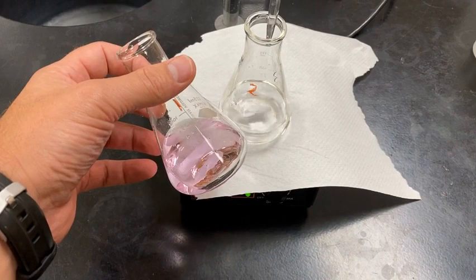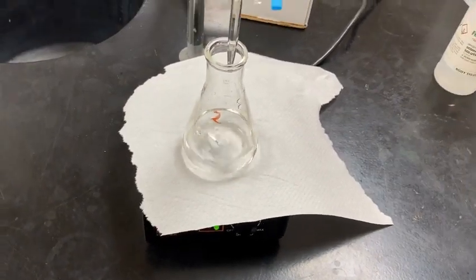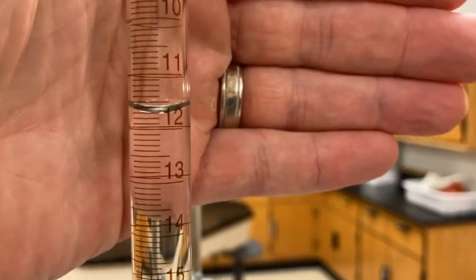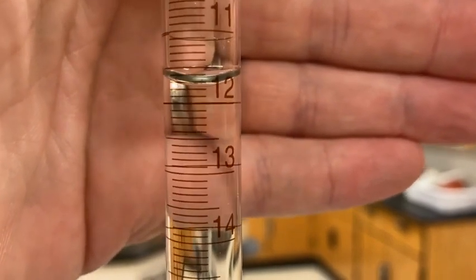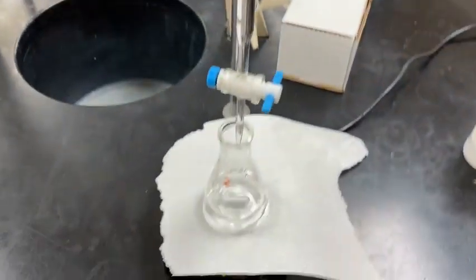All right, on to trial 2. All right, a little side-by-side comparison. Trial 1, and now trial 2 is ready to go. And let's get the initial volume again. I'm trying to start where I left off with the last titration. Let you grab that. I've got to pause the video to get it a little bit more accurate. Go for it. And then let's start titrating.